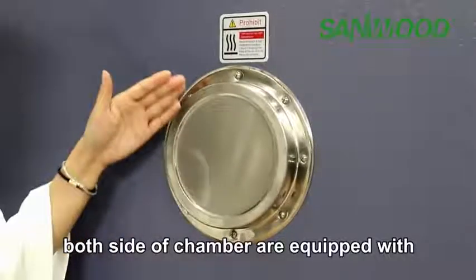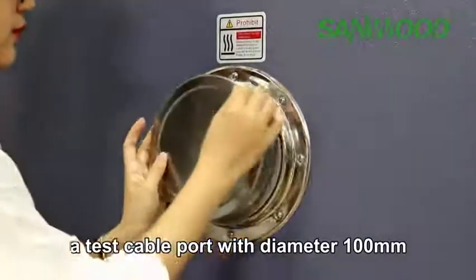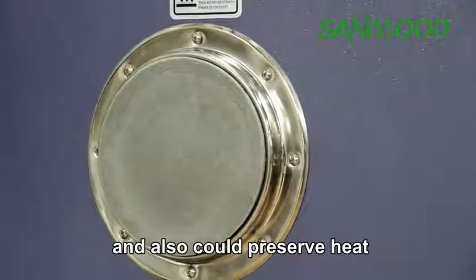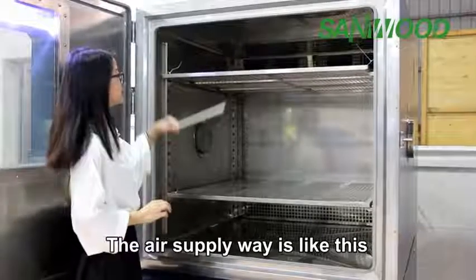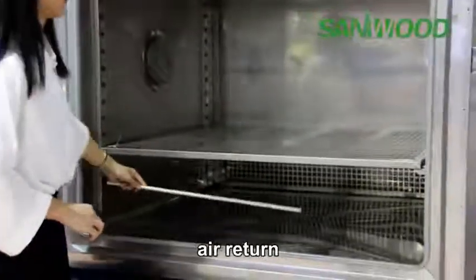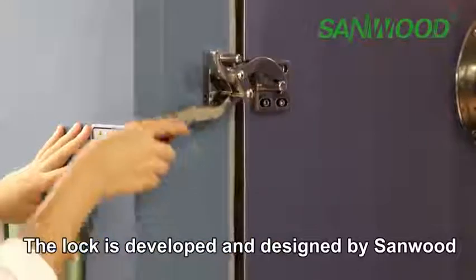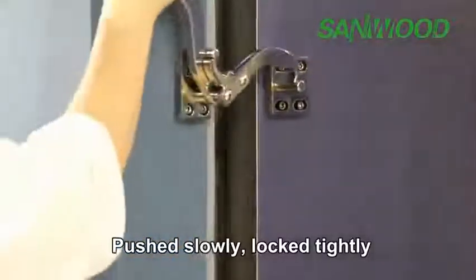Both sides of the chamber are equipped with test cable ports with diameter 100 mm. The plug material is silicone rubber, resistant to high and low temperature, and it can also preserve heat. The air supply way is like this: air out and air return. Safety lock. The lock was developed and designed by Sanwood, which adopts the lever principle. Push it slowly, lock tightly.